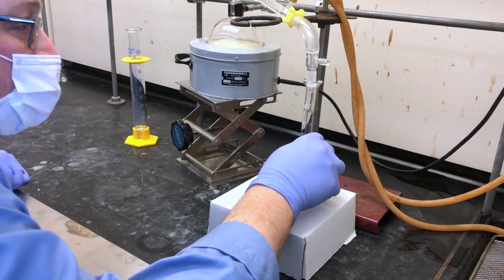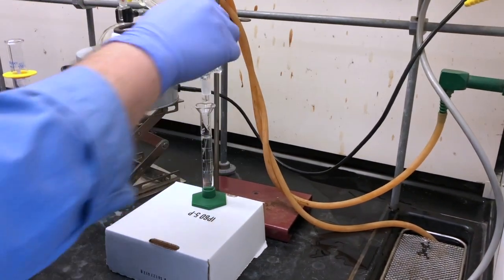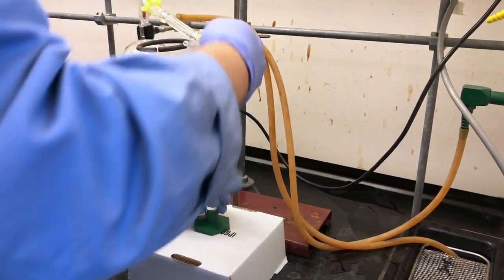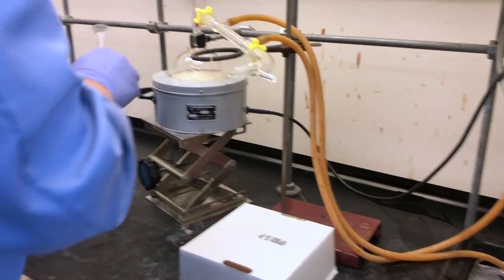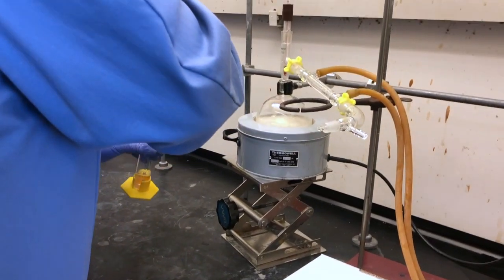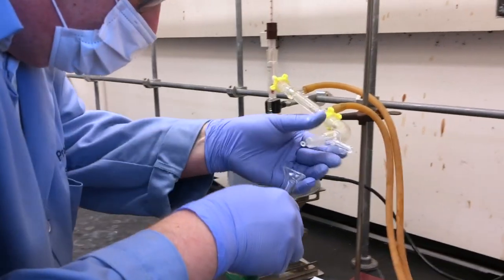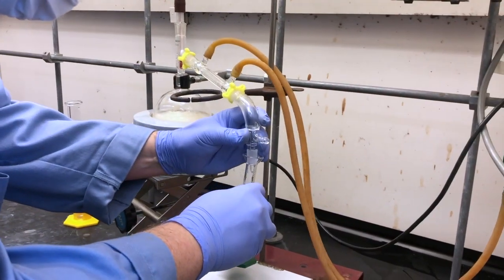Here's the procedure for emptying the 10 milliliters graduated cylinder. You can fold the condenser and vacuum adapter over to hold our condensing liquid for a few moments. Empty that into the larger graduated cylinder and rotate everything back in.